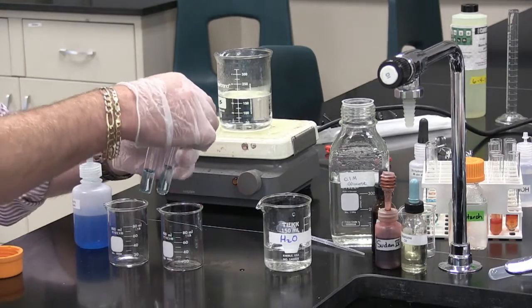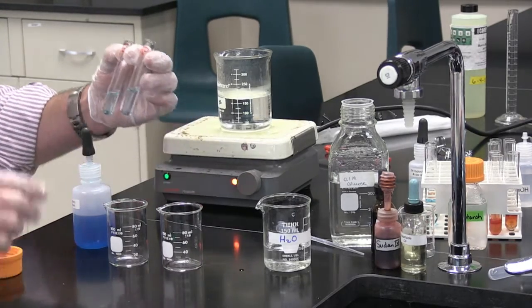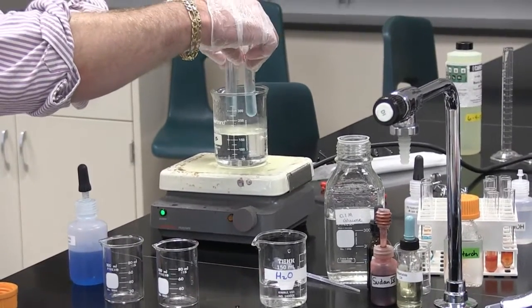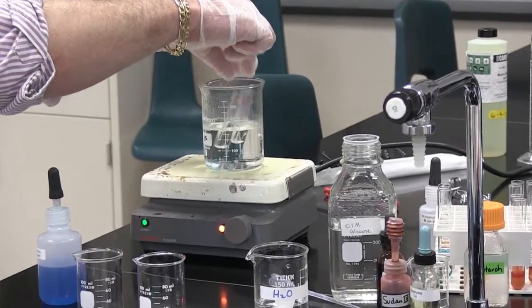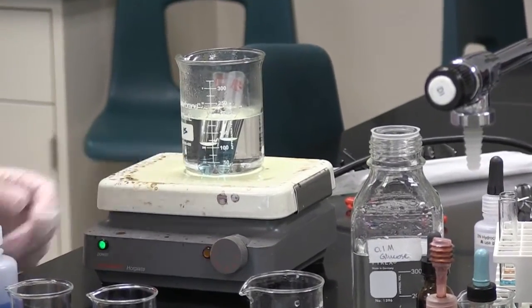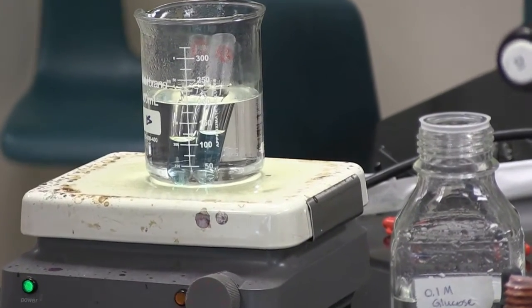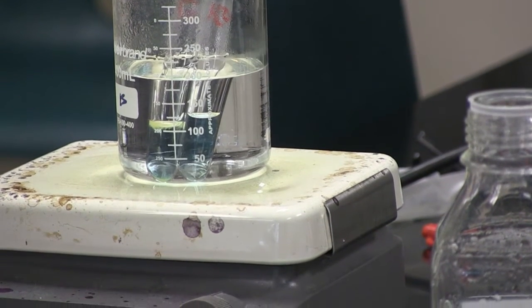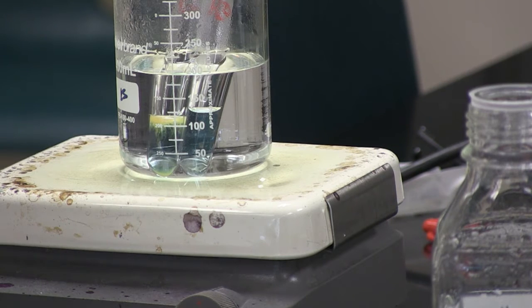You can see they are both a nice aqua shade of blue. The next step is to put each test tube into a boiling water bath. The test tube with water is on the right and the test tube with the glucose solution is on the left. We are looking for a color change, a change different from the color we presently have.